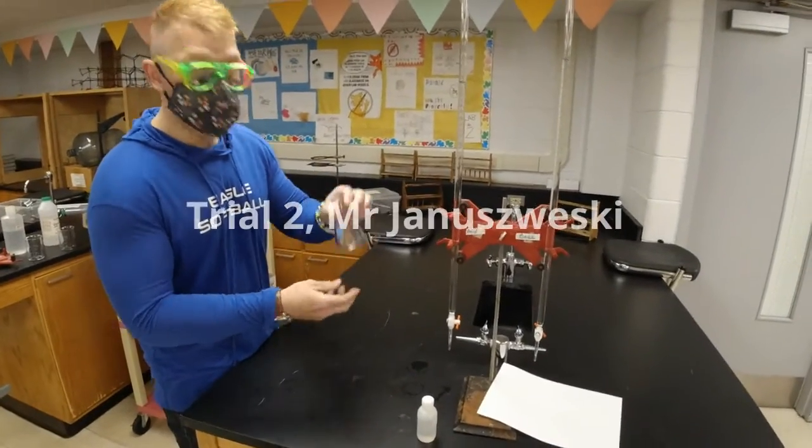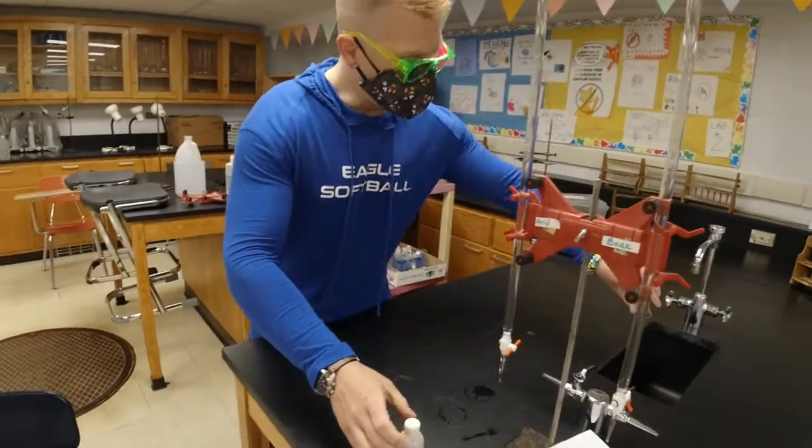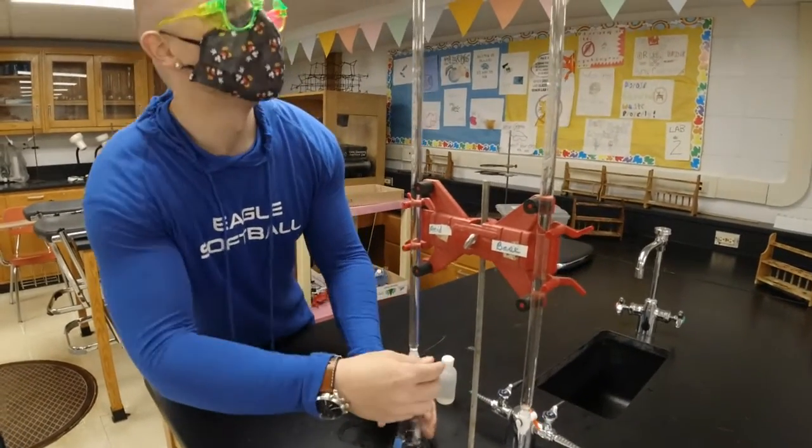All right, so I got some phenolphthalein, or no, this is just water? That's just water. I rinsed it out. You can pour that out if you want to. Okay. All right. By the way, you guys, this is Mr. Januszewski, chemistry teacher. He is the second team member here.